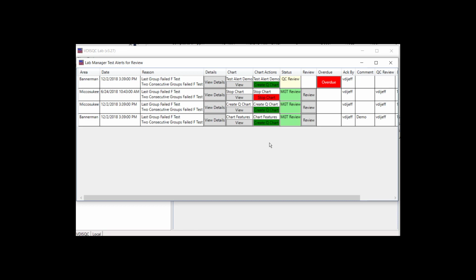Stopping a chart prevents any changes to setting or data. If two groups fail an F-test individually but pass against each other, a Create Q chart option appears. Chart settings are copied over to a Q chart and the historical standard deviation is automatically calculated.